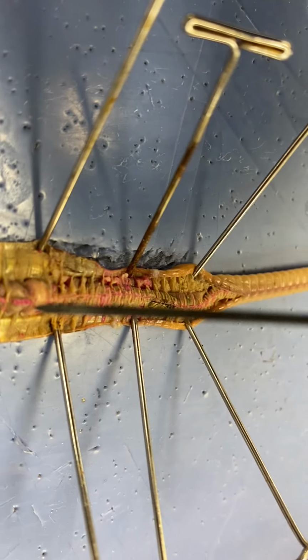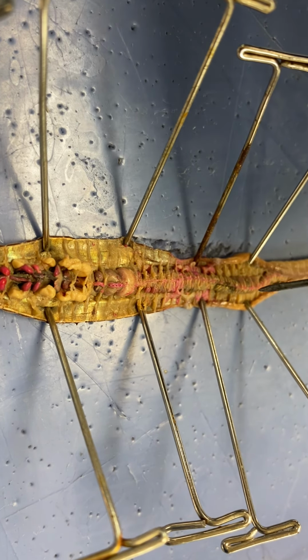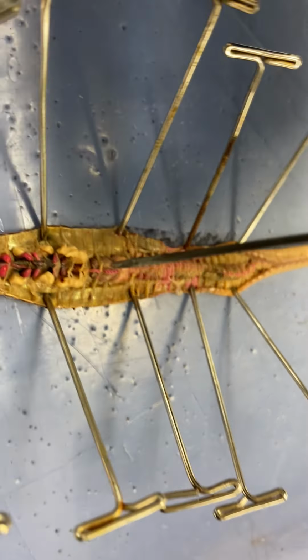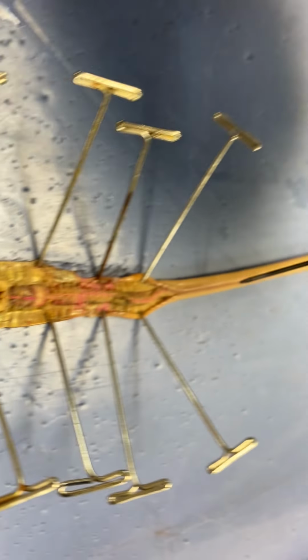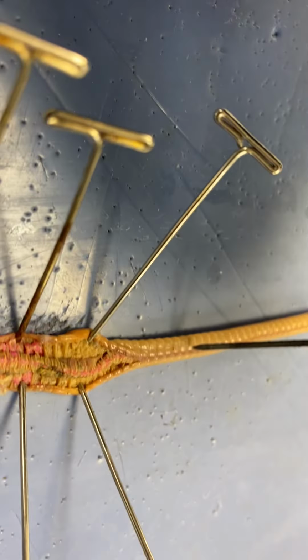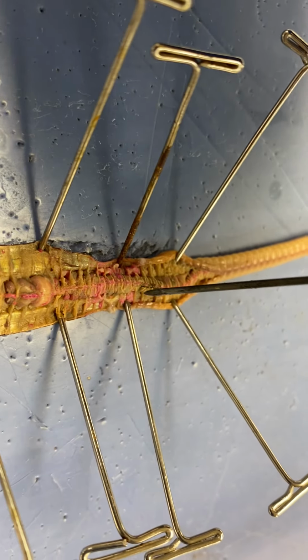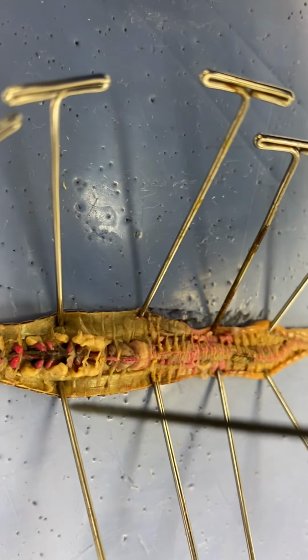This pink line that you can kind of see on the top is a dorsal blood vessel. And there is a ventral one on the underside too. So there's two blood vessels. So the ventral one, the one on the underside that we can't see, will transport blood to the posterior end, and it'll return on the top side. And then the dorsal one, that black line you can see on the top, is that dorsal blood vessel. And so the blood gets returned back to the anterior end from the dorsal blood vessel, because we are looking at the dorsal side, the top side of the worm, the back side.